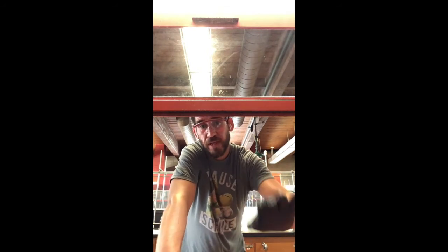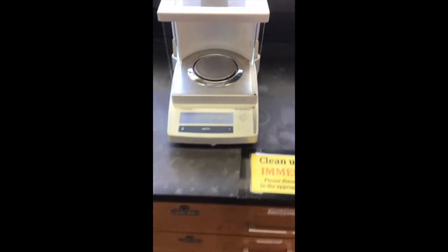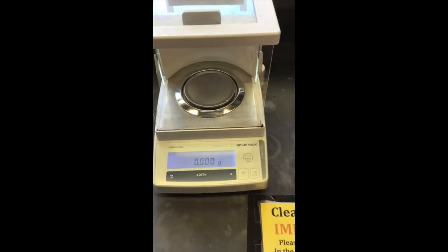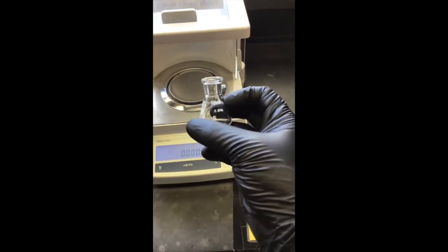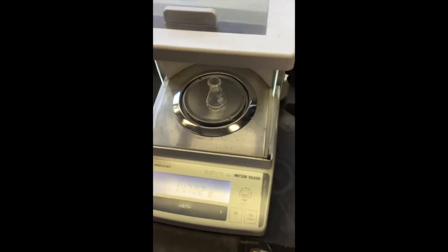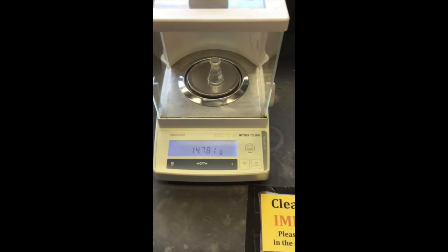What we need to do now is transfer the methylene chloride to a pre-weighed 10 ml Erlenmeyer flask. So let's go ahead and weigh that Erlenmeyer flask out. All right, as I roll up to the scale, we got a mass on there, or negative mass. So I'm going to zero that out or tare it. I'm going to place this cute little 10 milliliter Erlenmeyer flask that is nice and clean right on there. We're going to close all the doors. We need some privacy for this guy while he gets weighed.